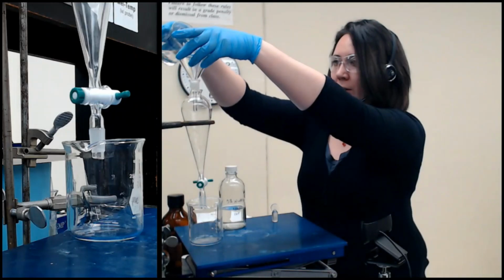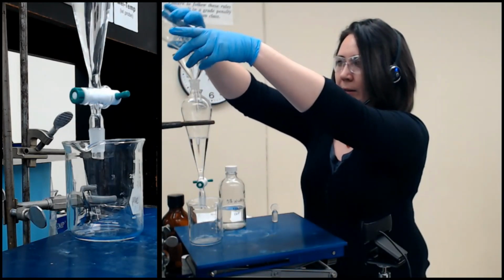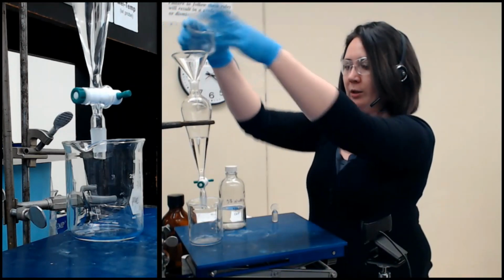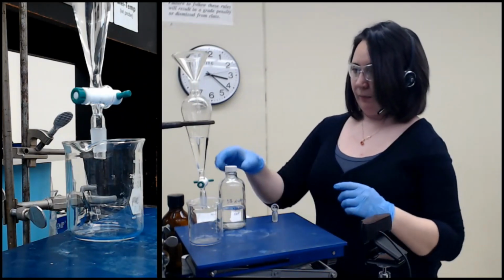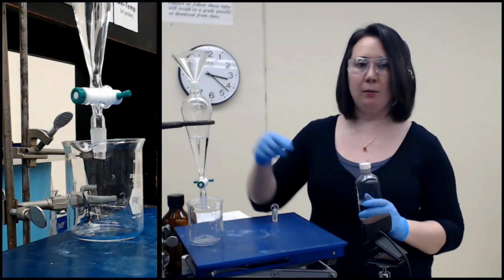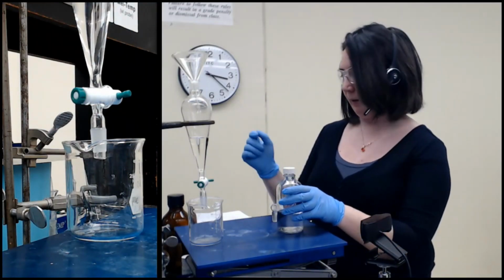When we form a salt, it becomes water soluble, and that means it's going to move from the ethyl acetate layer into the aqueous layer, which again for us is the sodium bicarbonate. From there, we'll have to do a couple extra steps to get it out of here, but at least that will get the 2 components away from each other in the ethyl acetate.